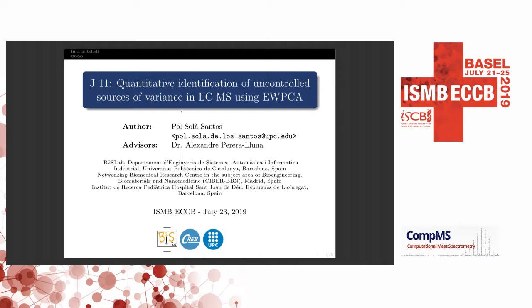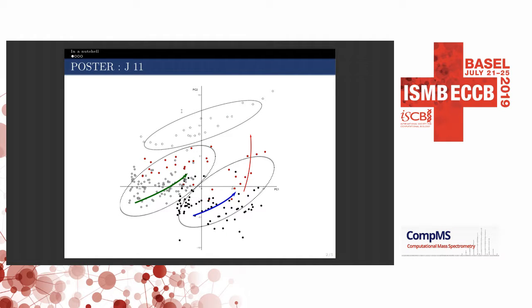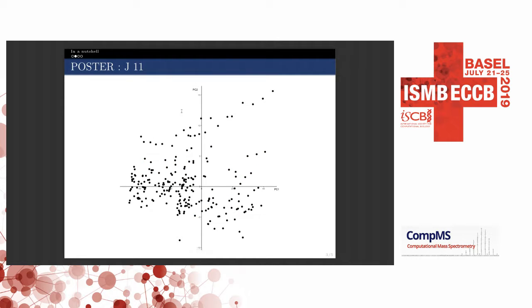This method is aimed to be a quality control algorithm for LC-MS signals. Normally, when we receive this type of data set, we make a PCA and start to plot in here all the variances that we know. For example, we have batch effects, drifts, and blanks, and for example, in red, we were lucky and have the concentration of the samples, which we usually do not get for, for example, a urinary data set. But what happens if we do not have anything about this information, if we do not know those uncontrolled sources of variance in the data set? This is what we are trying to tackle in here.